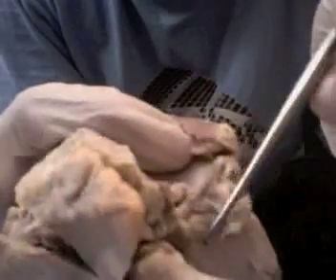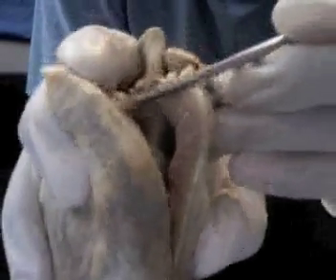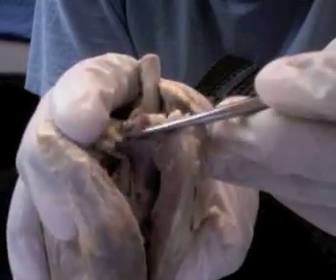We also have the pulmonary semilunar valve, which if this is your pulmonary trunk, it goes through to the ventricle, and dividing that is the pulmonary cusp. Or sorry, the pulmonary semilunar valve. Trying to get a view of it. Right there.